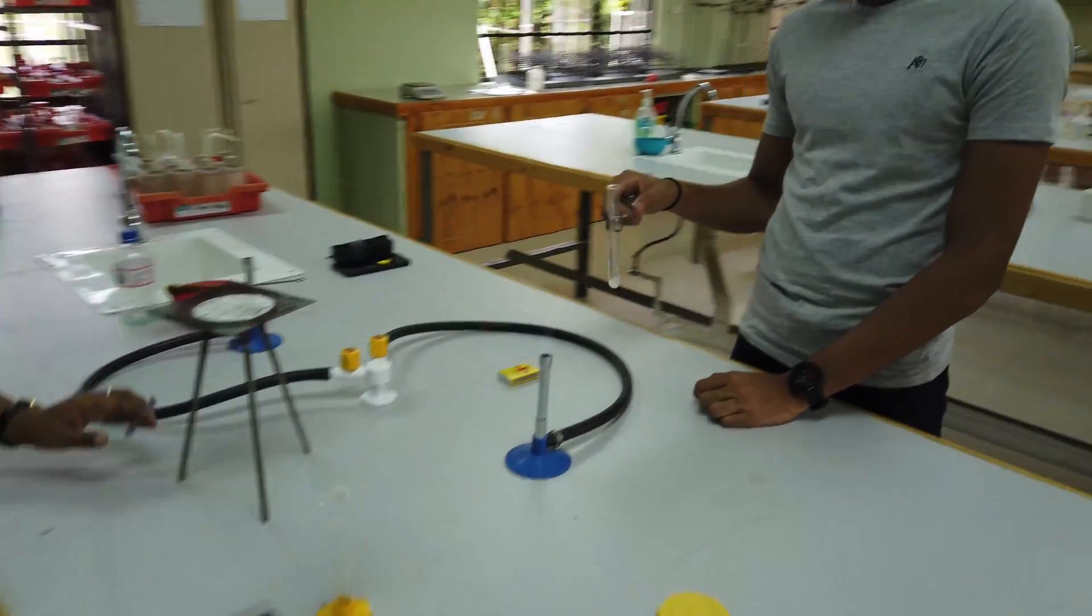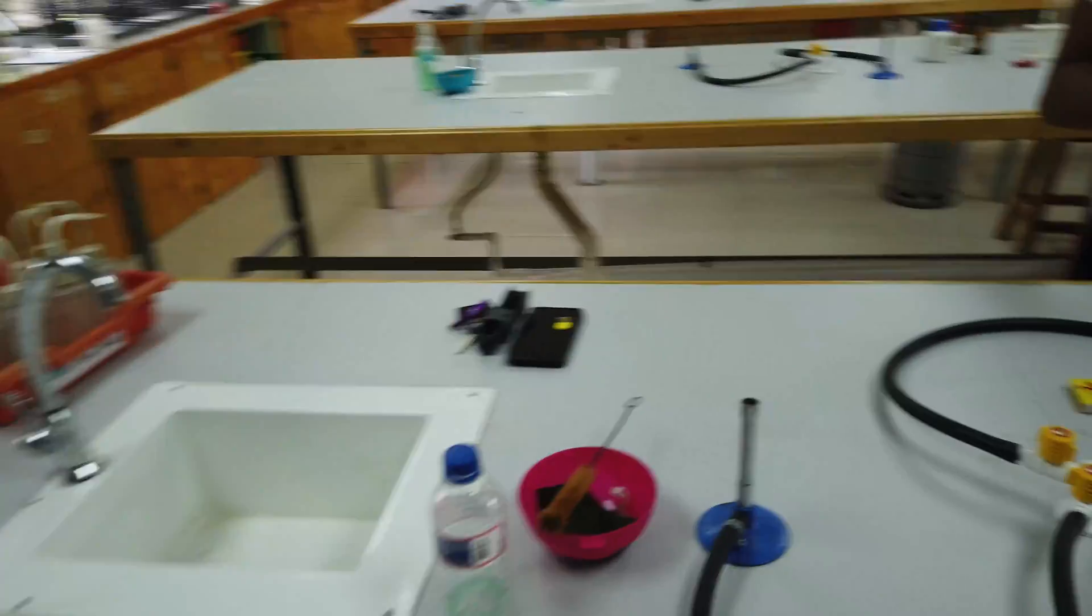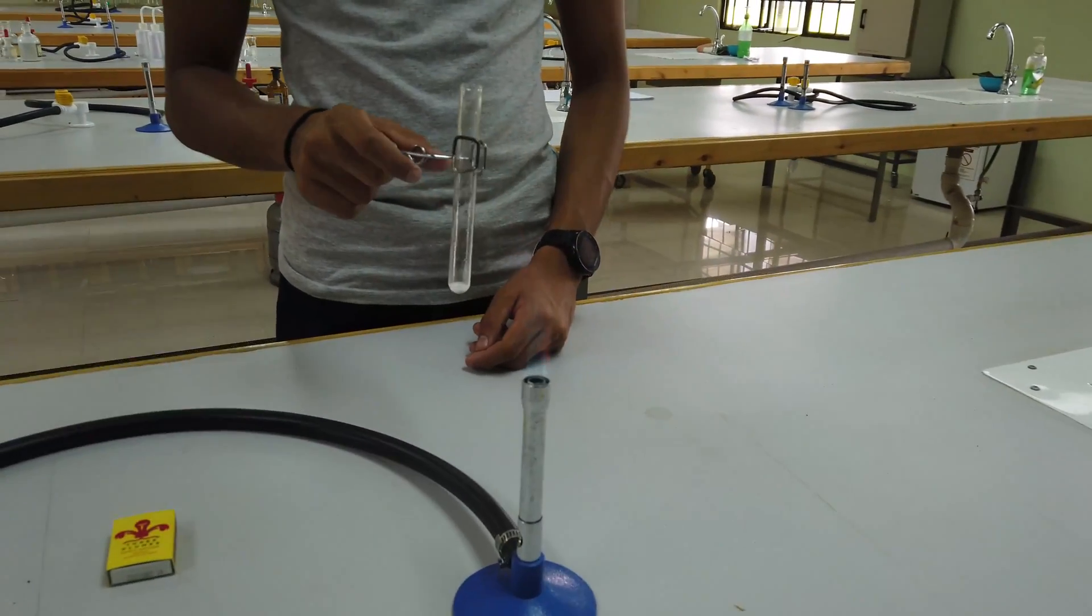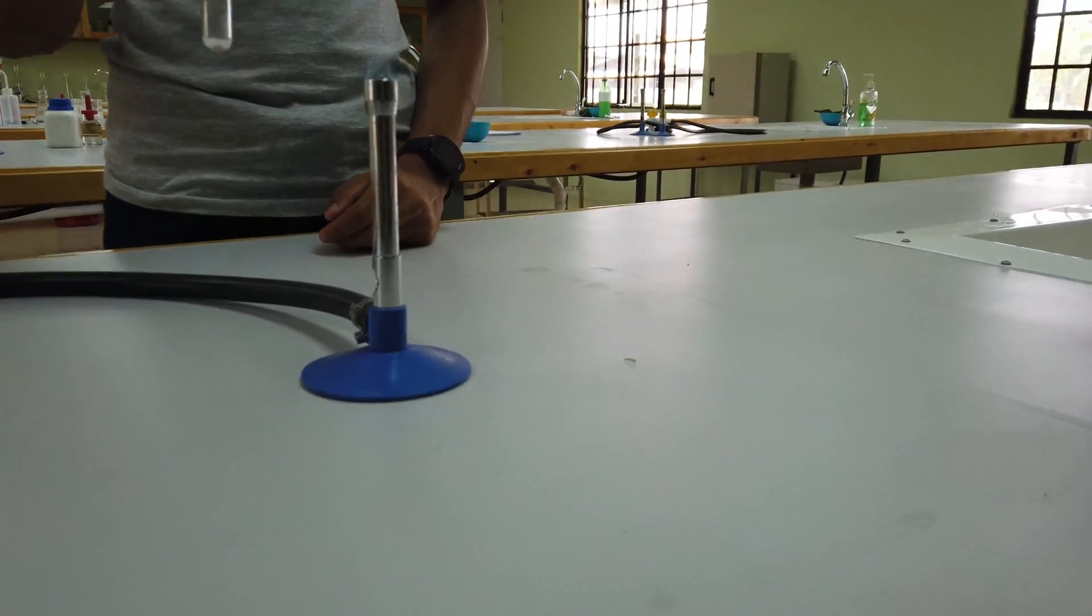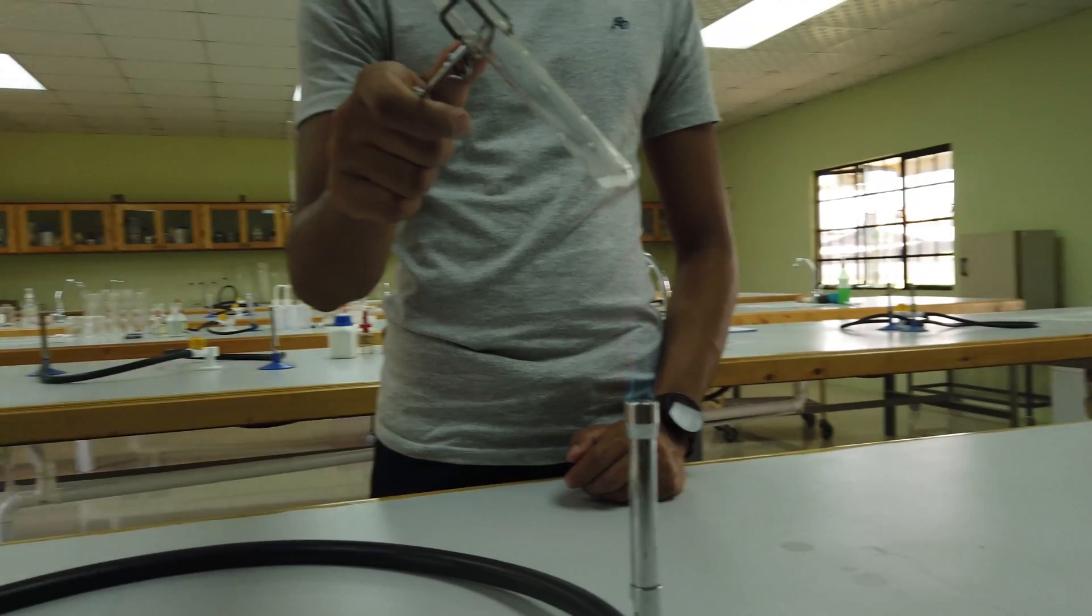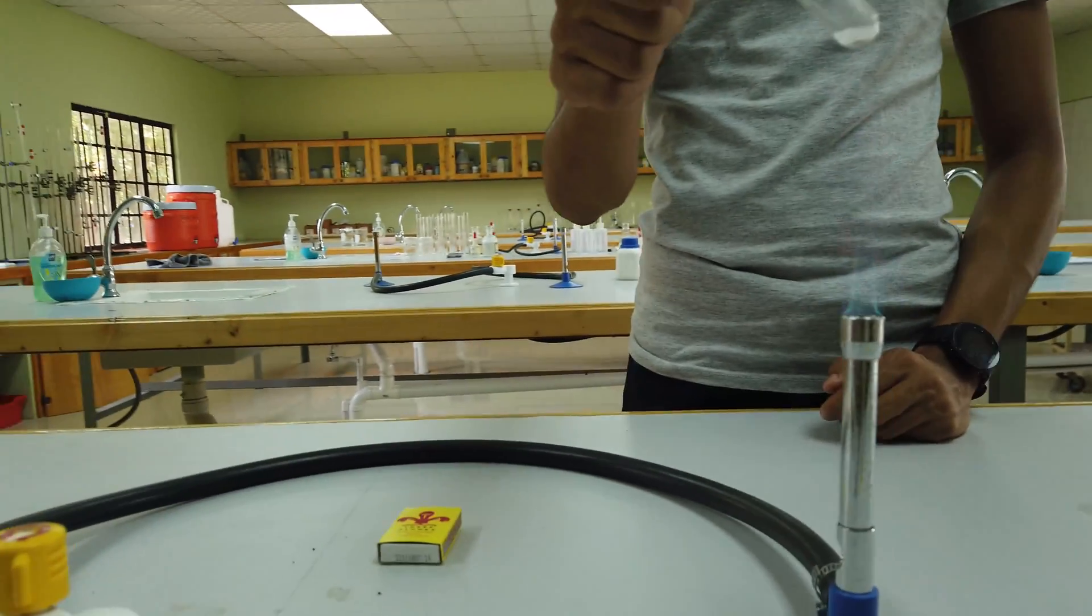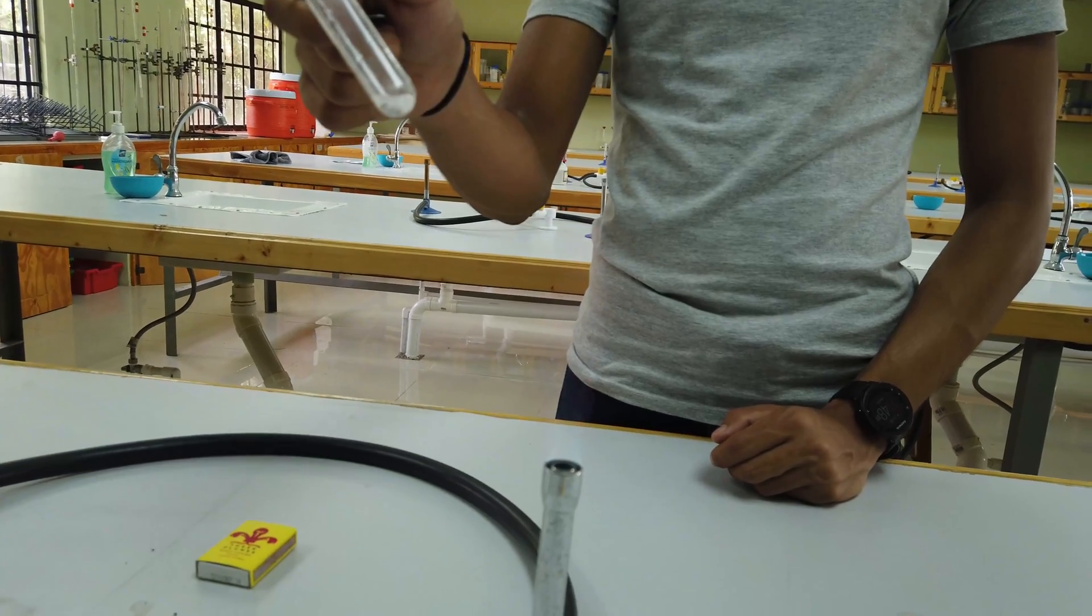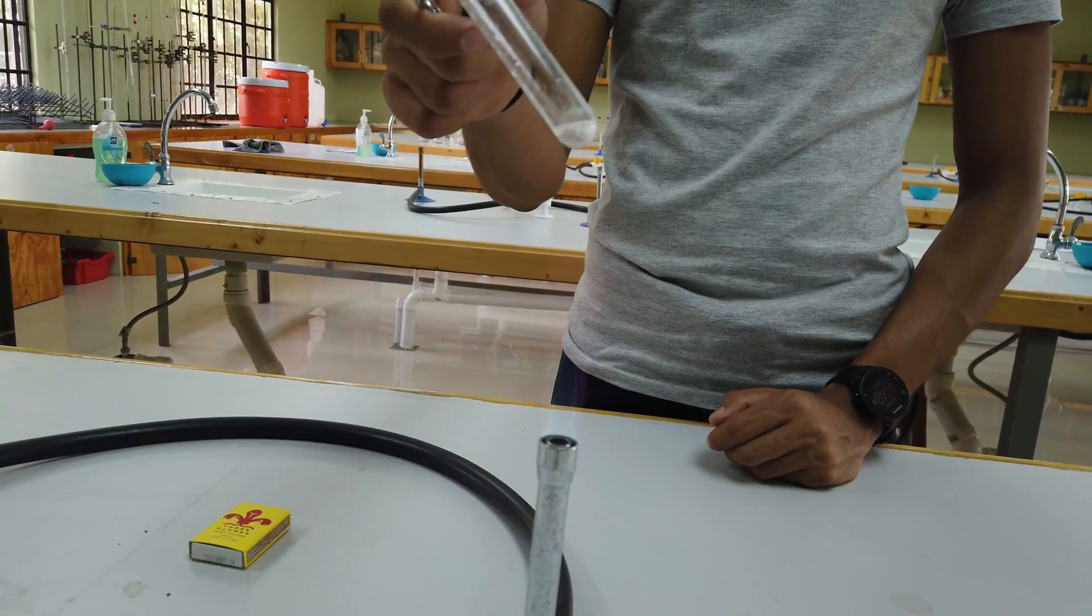Really risking his life for you guys. He's going to hold the test tube at a 45-degree angle so that it doesn't face his face. So he's going to put it into the flame.